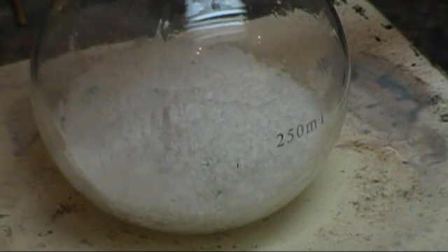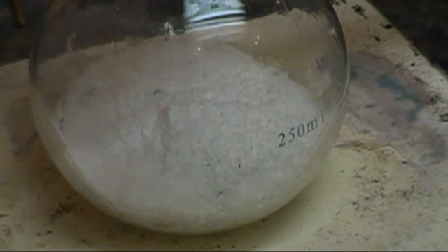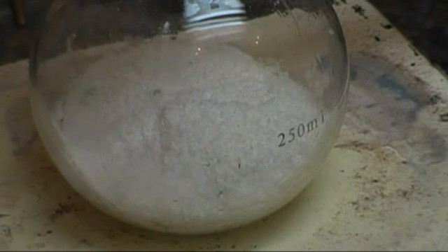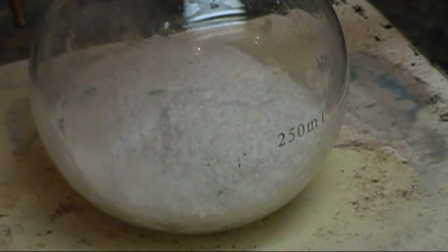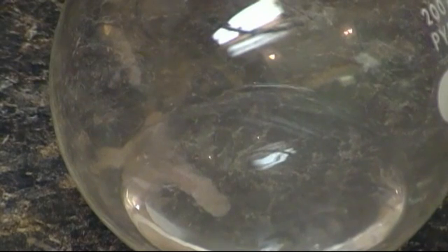You may have noticed that I'm not using stoichiometric amounts of my reactants. I found that this works much better if the low melting sodium hydrogen sulfate is in excess. If it's not in excess, I found that the sodium acetate will begin to decompose.